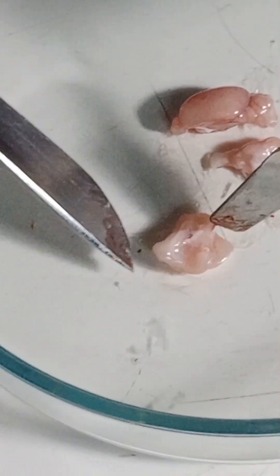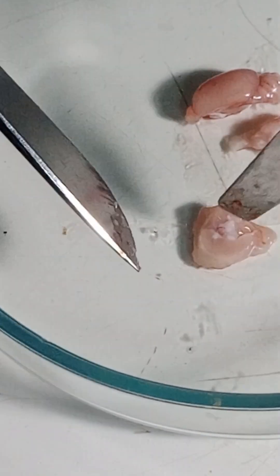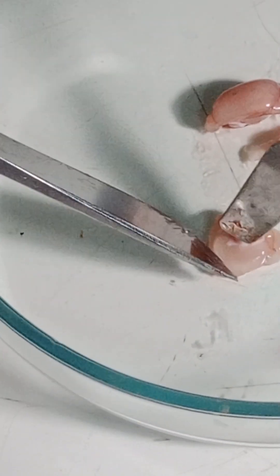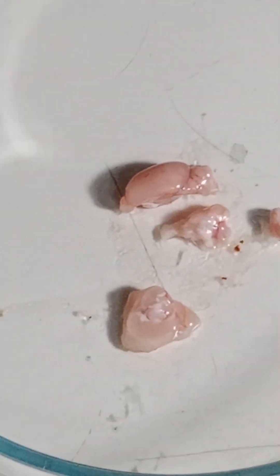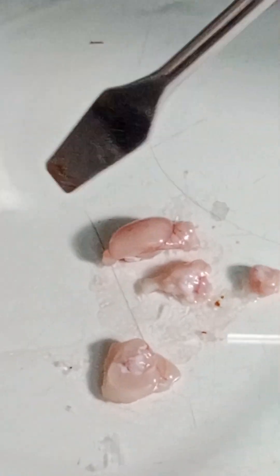I found some videos on YouTube guiding this in a different way. Although those videos are very nice, I thought I should do the experiment myself and then make and upload my own video. Today I am successful. I am guiding you on some things to keep in mind, because mouse brain tissues are very sensitive.